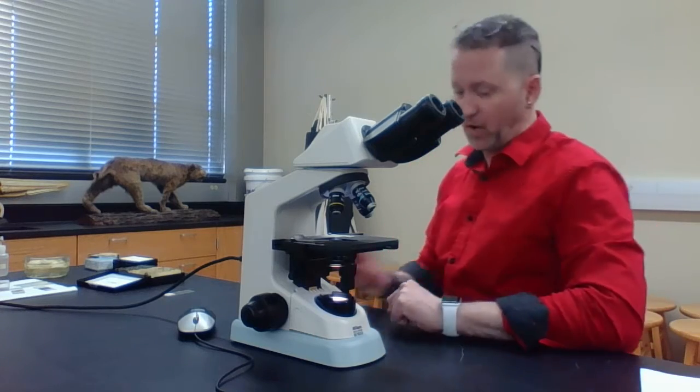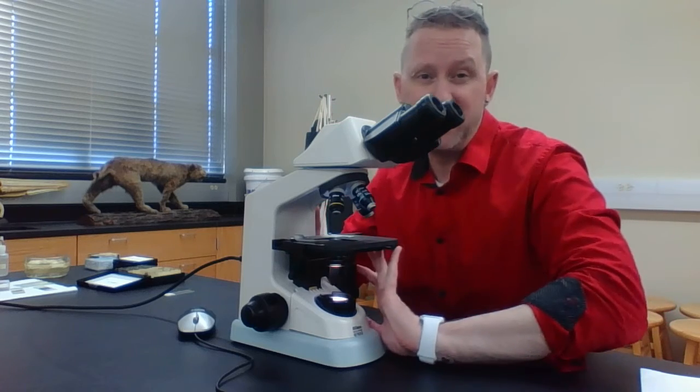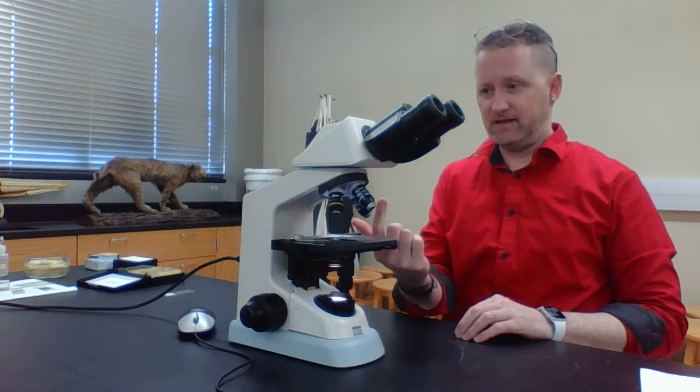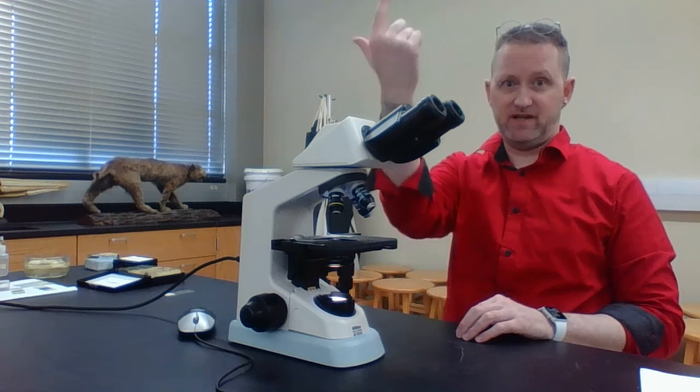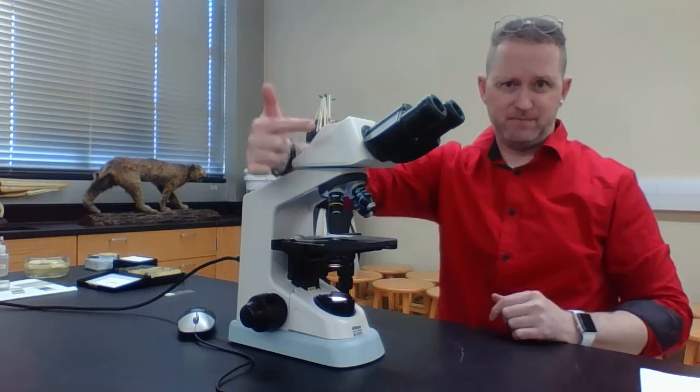Next thing, which I've seen a lot of people do, and which I think I made that mistake earlier, is scooting the microscope. When you scoot the microscope, notice that the light is going to travel in a single direction. But notice that your ocular lens is basically off here.